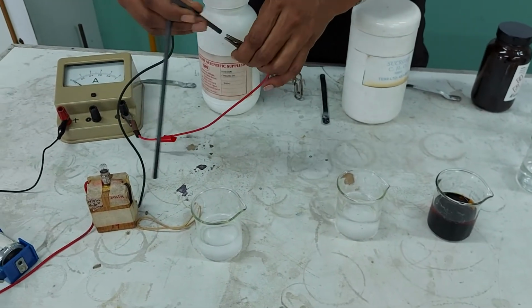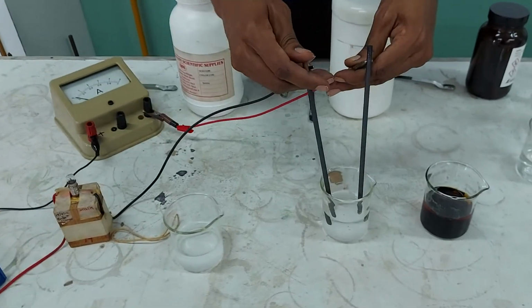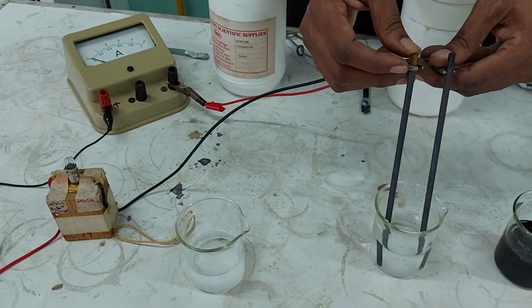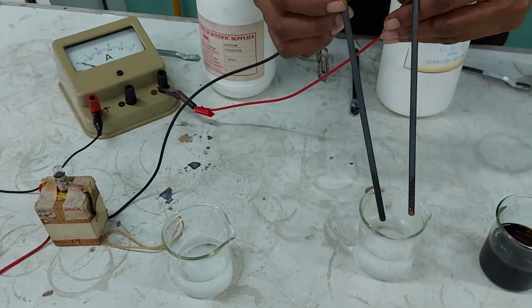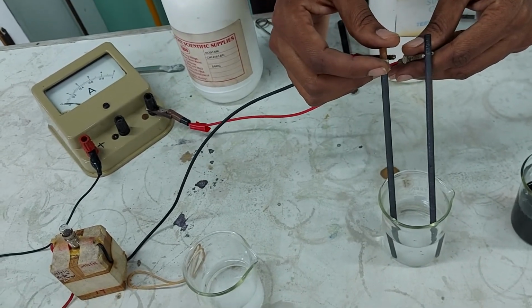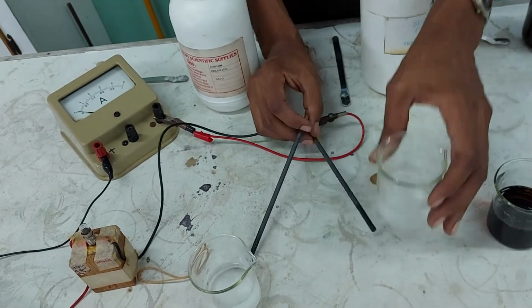I'm going to go on to check out what happens with my sucrose. Is my sucrose going to be any better? Miss, are you seeing anything going on there? Slight. All right, is there movement? Let's see. I'm going to try it again. This is sucrose. Does it conduct electricity? You tell me. Okay.